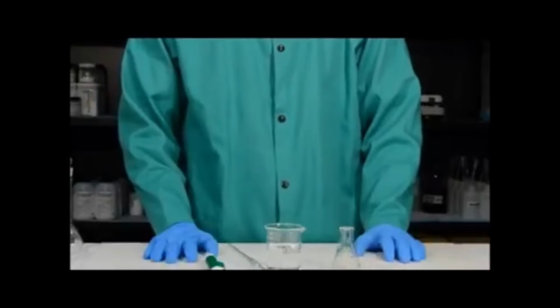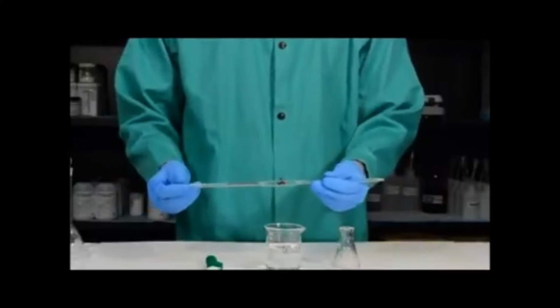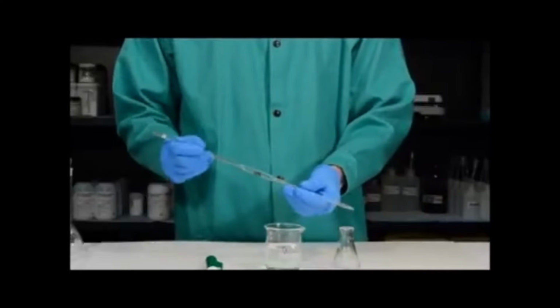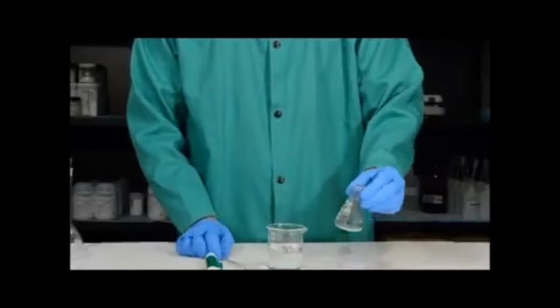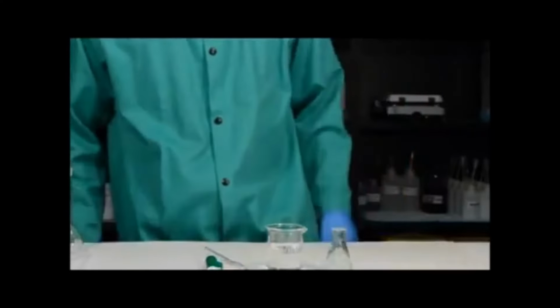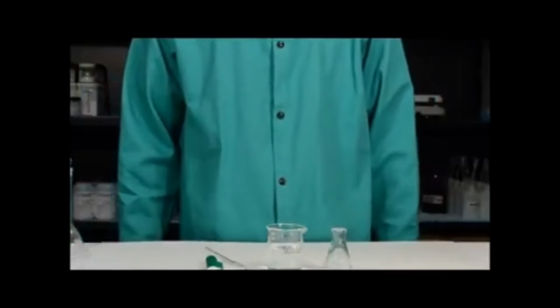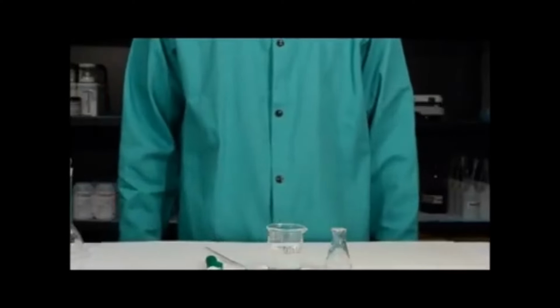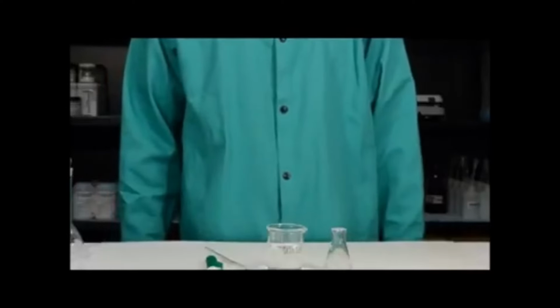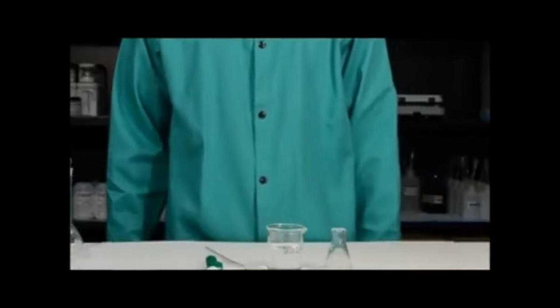In this experiment, you will determine the volume of water transferred using the volumetric pipette by mass. Over several trials, you will transfer 5 milliliters of water from the beaker into an Erlenmeyer flask and record the mass. Knowing the mass of the empty flask and the mass of the flask after each subsequent trial of water has been added, you will subtract and find the mass of the water for each trial. Then, using the temperature of water and the density, you will determine the volume of water transferred for each trial. In this way, by doing the experiment repeatedly, you will test the precision of the experiment.